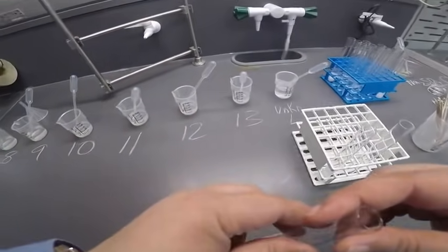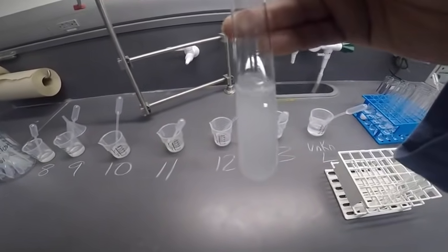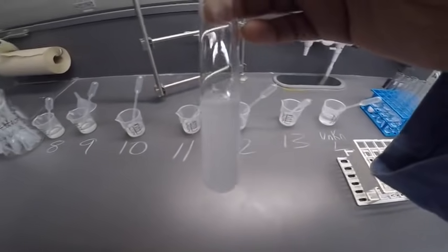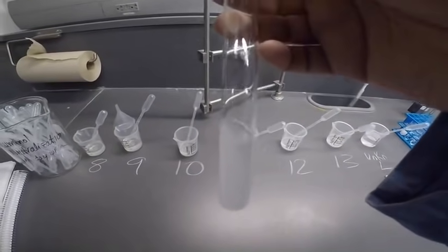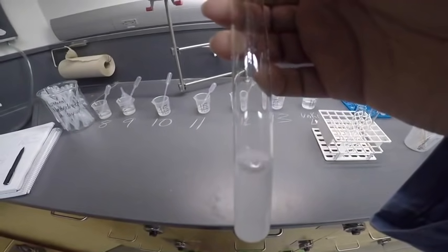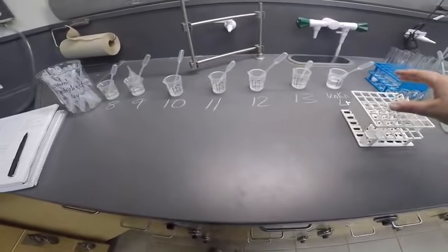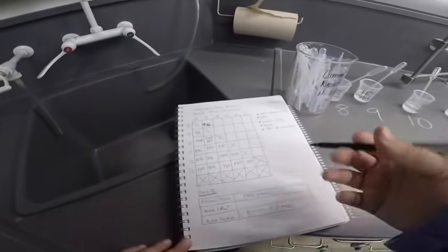All right. And let's go back to that other test and look at that. It just took a little bit of time. So this is back to looking at the sodium sulfate plus unknown L. That gave a precipitate. It just took a little bit of time to form. So I'm going to go back and say precipitate.